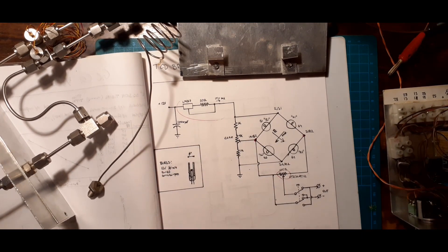I have an attenuator here. That's not a terribly good idea, because once you change that, it's going to be difficult to replicate. What I really wanted is a fixed attenuator, but for the test run I just used a potentiometer.